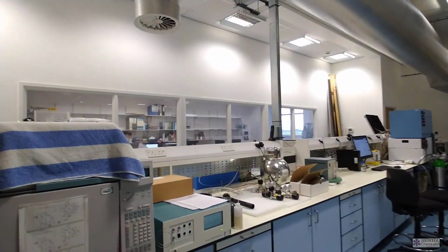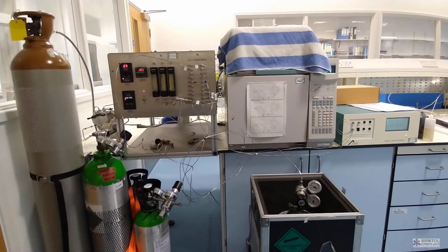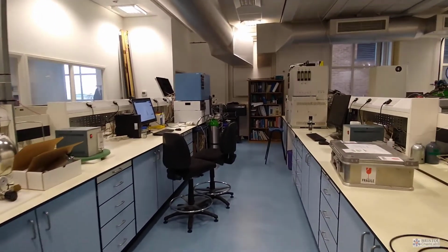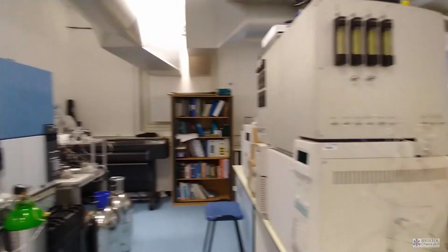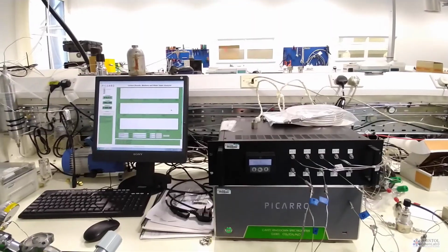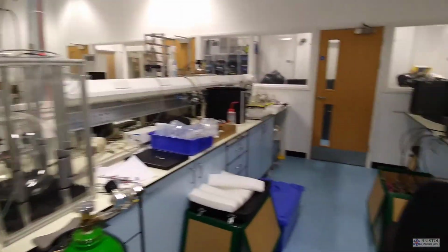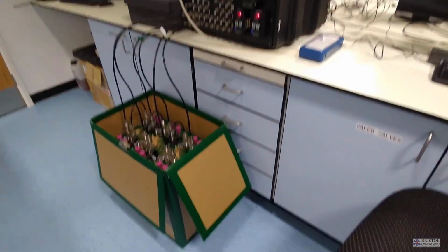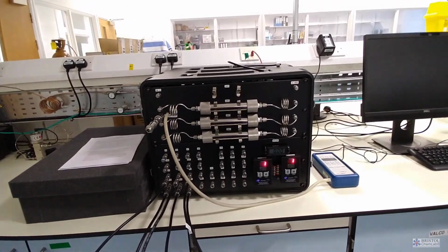Our group does atmospheric measurements and modeling. But since this is a lab tour, I will mostly show off our instrumentation. You probably know what computers look like. As you can see, we have a lot of boxes. They're not necessarily black boxes. They're mostly gray boxes, some beige ones, and at least one pretty blue one. This is not really how people imagine laboratories to look, because we measure the concentration of stuff in air. You cannot really see what the machines are doing by eye. So I'll try to explain a little bit of what happens in the boxes and what we are doing with it.